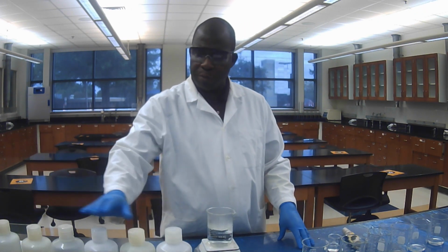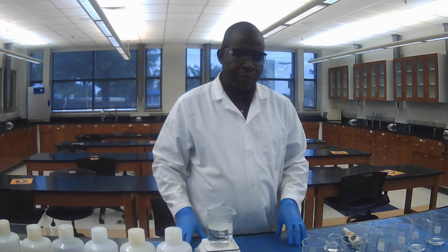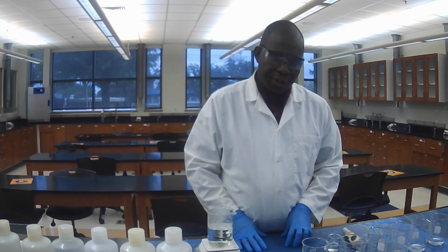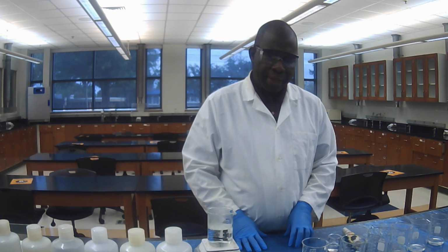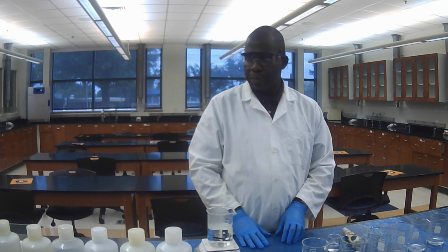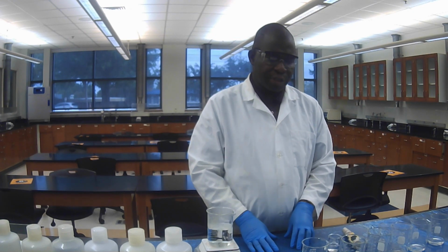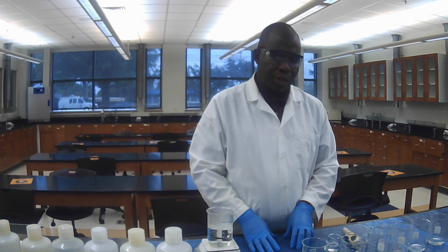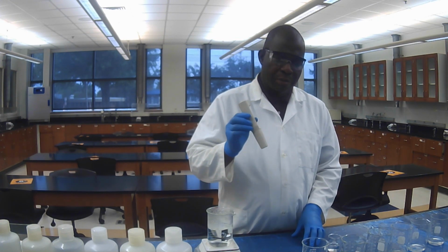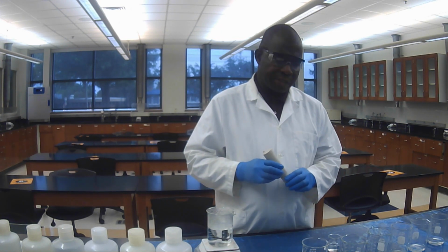We have sodium chloride, ammonium chloride, sodium acetate, sodium carbonate, zinc chloride, and also potassium alum. Okay, so first thing to do to start part 1 of the experiment is to obtain a pH meter and calibrate it if necessary.